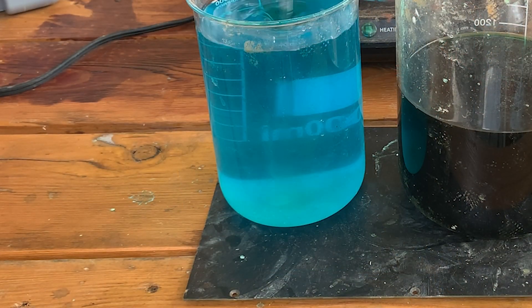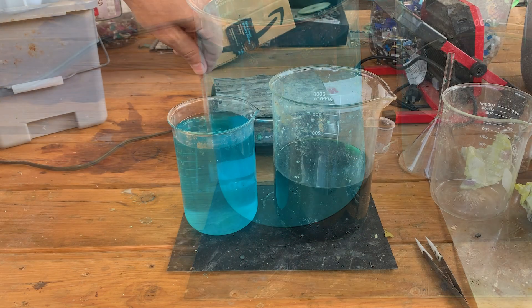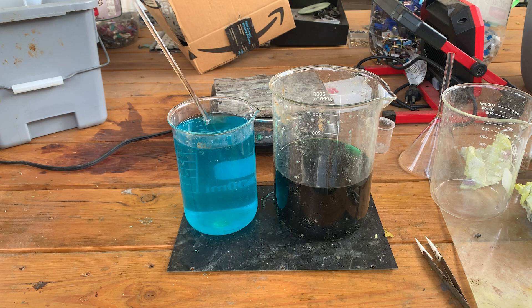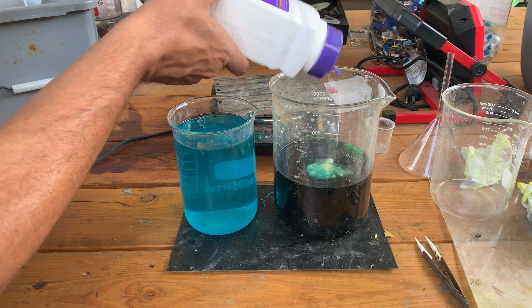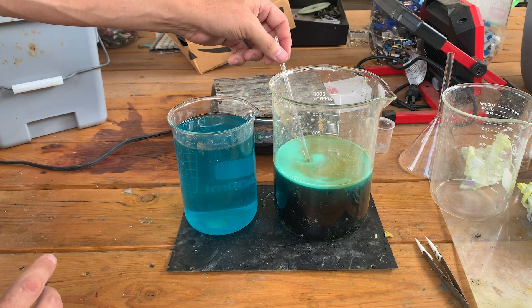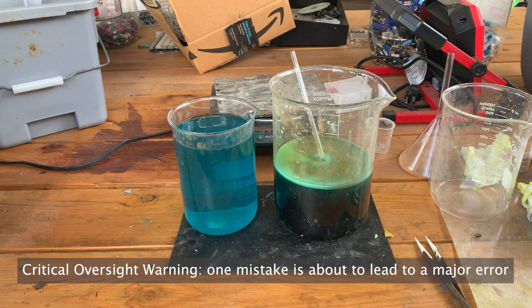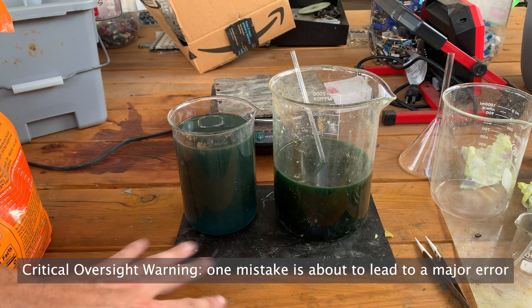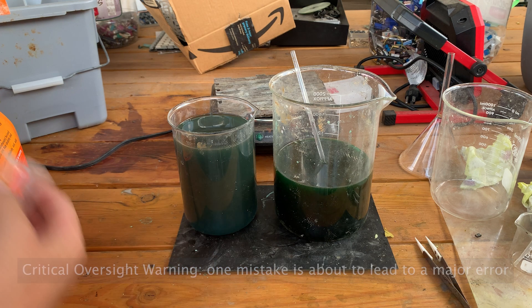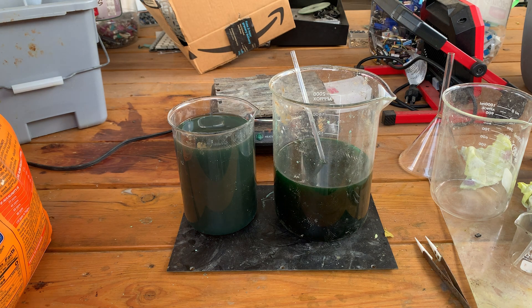You can see at the bottom there's a little bit of a cloud forming. I can smell that metallic lemon smell — I think I figured out what it is; it's the smell of the nitric. Oh, you know what I forgot to do? I added a little bit of water but I didn't add my sodium bicarbonate. So that was a mistake — I didn't mean to add the sodium metabisulfite quite yet. I need to add some baking soda first.